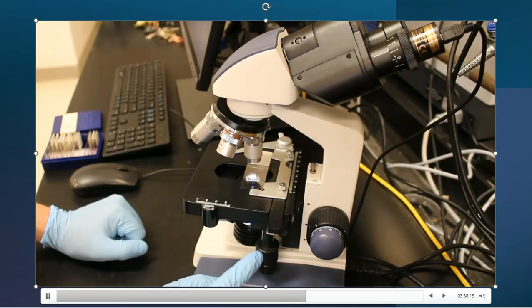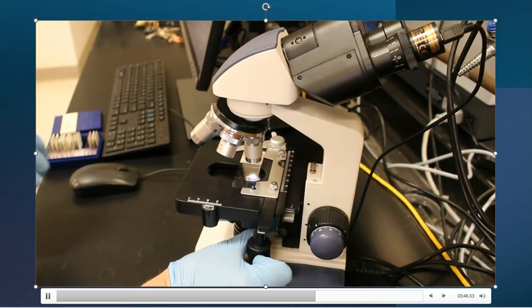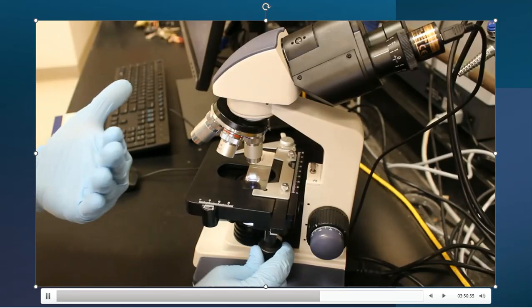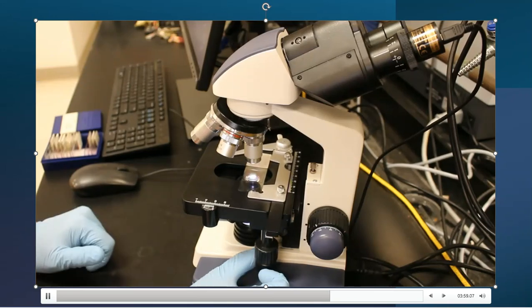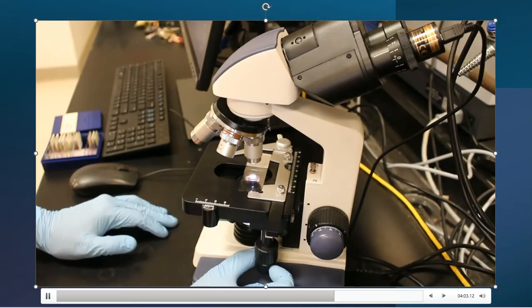And to do that, those are the purposes of the two dials here. So again, the bigger one on top will take it backward and forward, so that way I can position the sample directly under the lens of the microscope. And then the dial down below is a left-hand adjustment and a right-hand adjustment. So I've got movement in all four of those directions, so that way I can line up my sample underneath the lens the proper way.